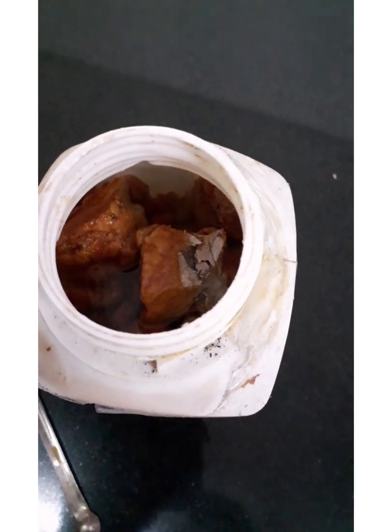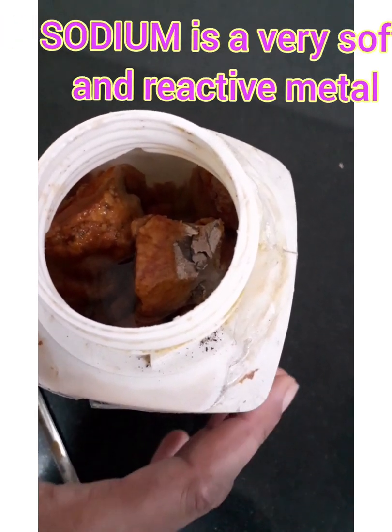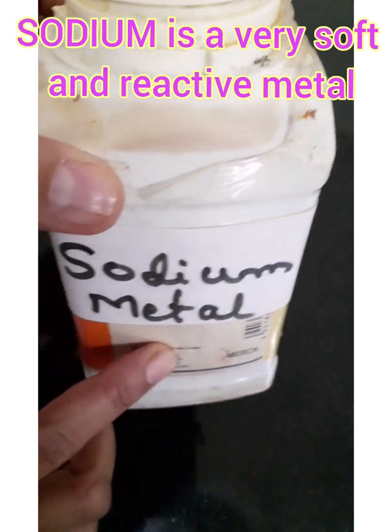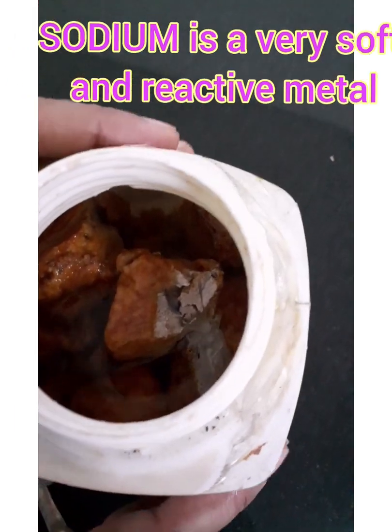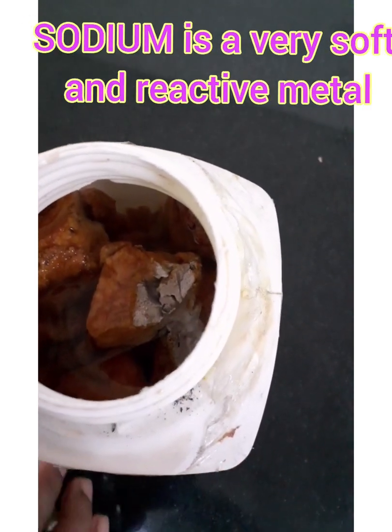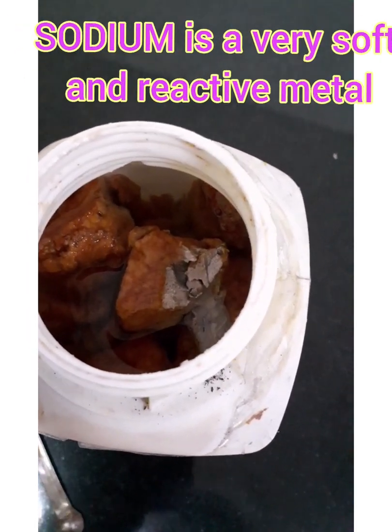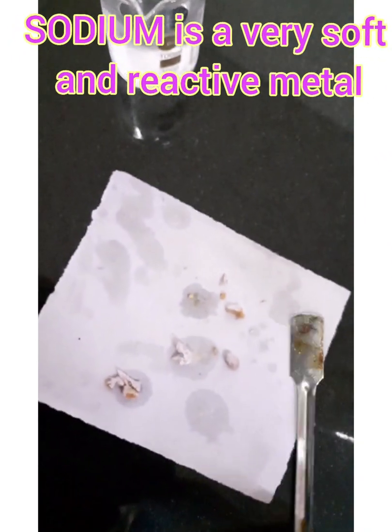Good morning everyone. You have read that sodium metal is one of the exceptions. This is the sodium metal and it is placed in kerosene because it is so reactive that it catches fire when placed in the open air or water. It is an exception compared to other metals.